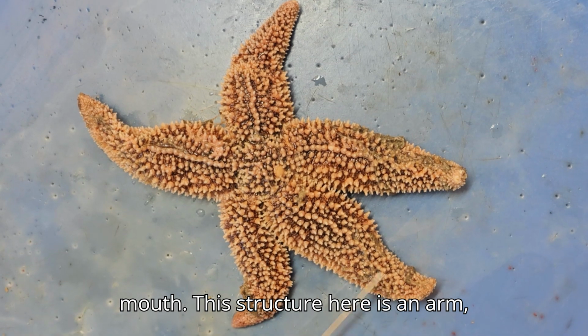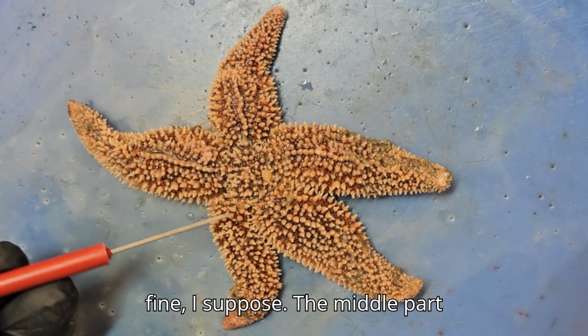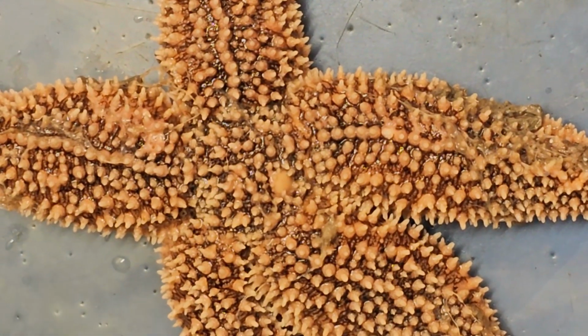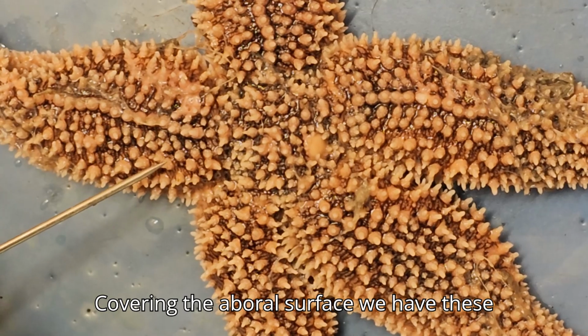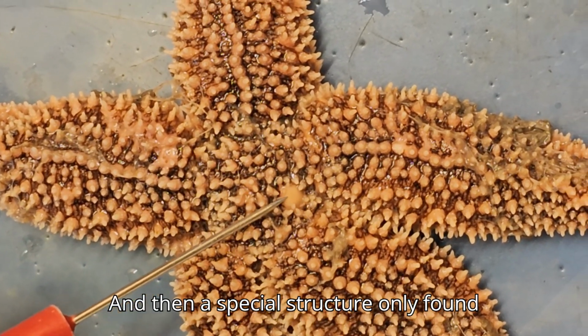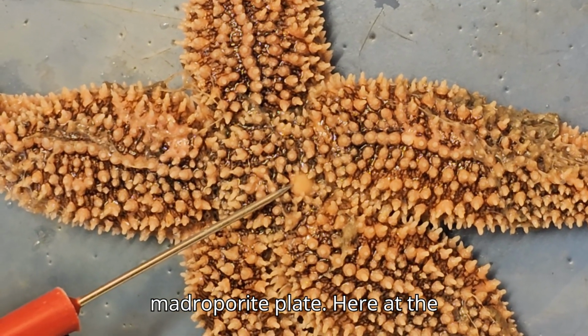This structure here is an arm. Used to be called a ray. Either term is fine, I suppose. The middle part is the central disc. Covering the aboral surface, we have these little pokey things called spines. And then a special structure only found in the central disc is the madreporite, or madreporite plate.